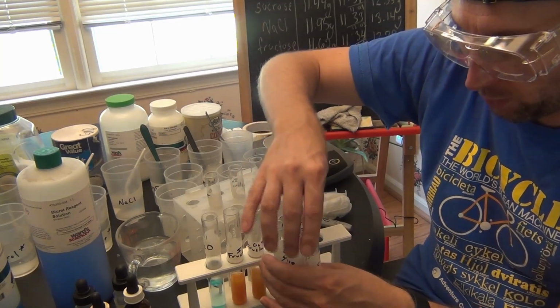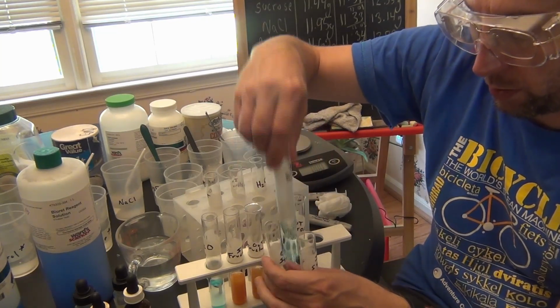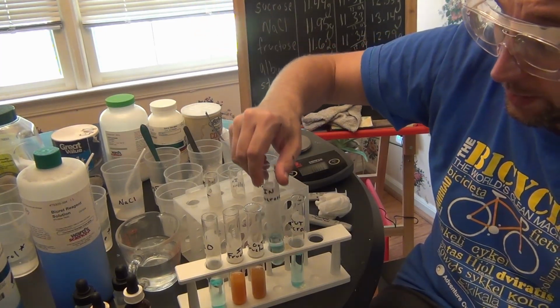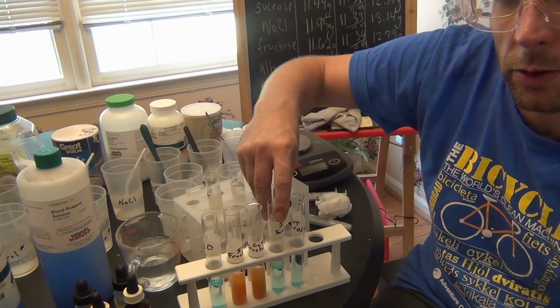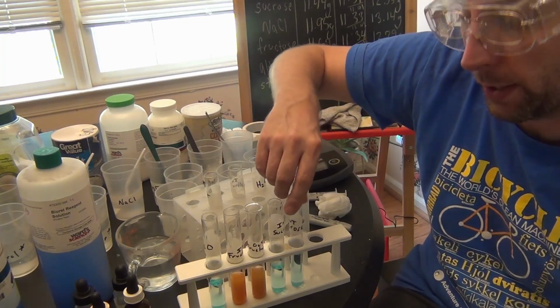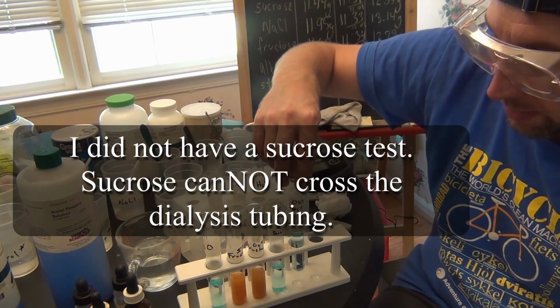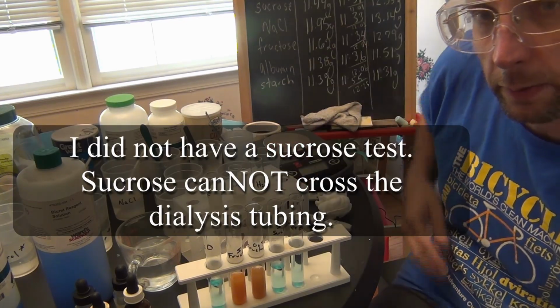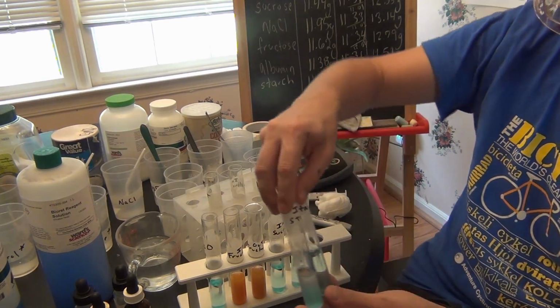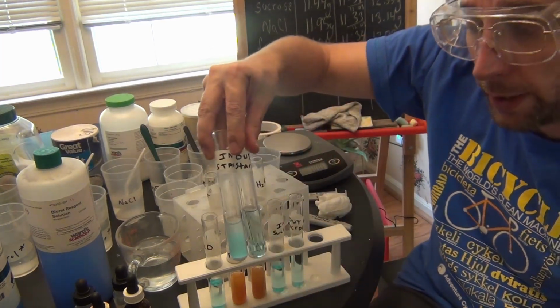Now for sucrose, sucrose is negative on the inside. Disaccharides like sucrose are considered non-reducing sugars, and they do not test positive for Benedict solutions. Outside also, since it doesn't test positive on the inside, it's not going to test positive on the outside. Starch also would not test positive for Benedict solution.